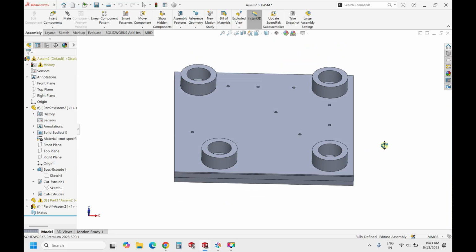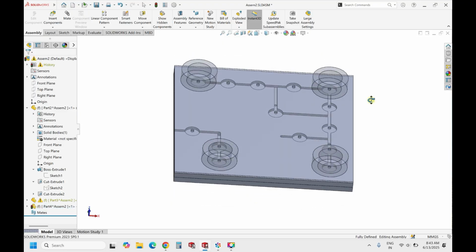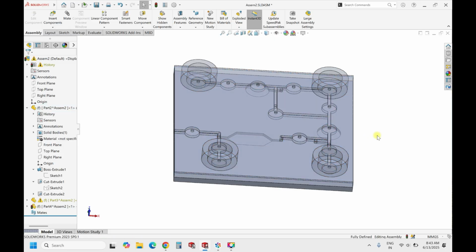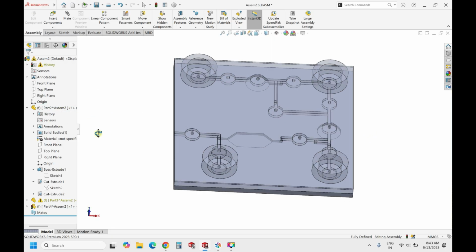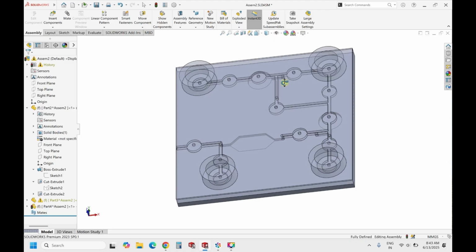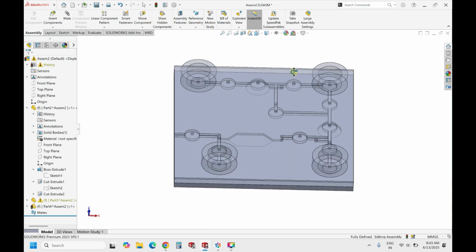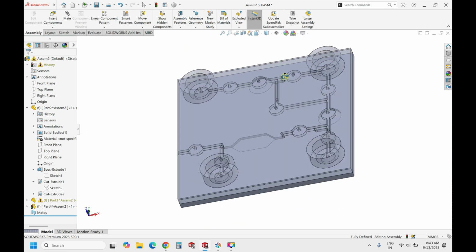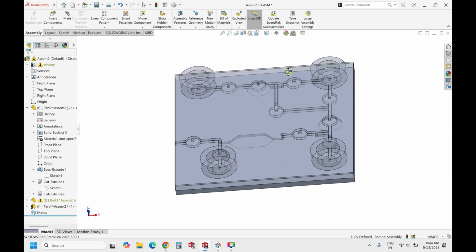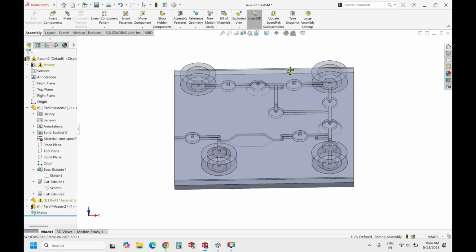Now it has the internal walls, so these act as the walls. Once we make it transparent, you see this, and when you make the internal layer also transparent, you can see this. So this is the complex design. When a beginning researcher or beginner in research sees it, it looks complicated due to these internal layers and internal structure. I think this is the first video ever going to be published on YouTube on designing a multi-layered channel or multi-layered designing in microfluidics.